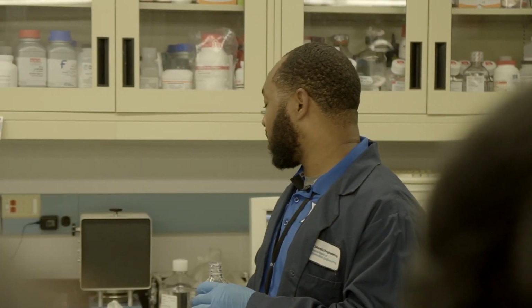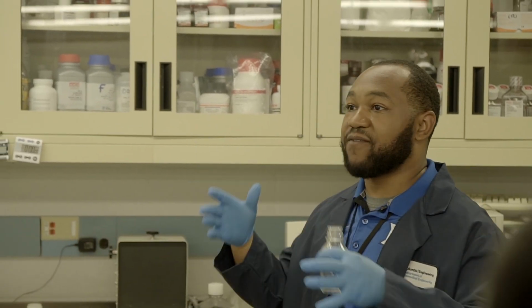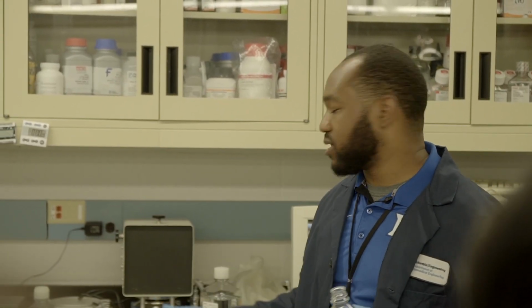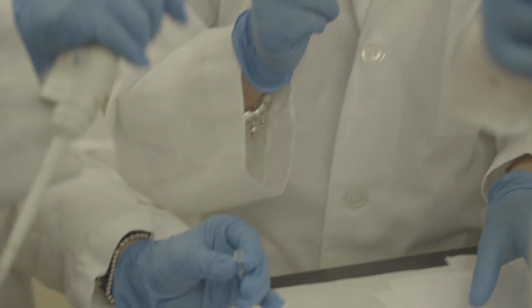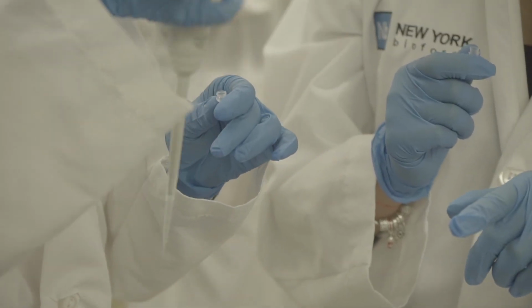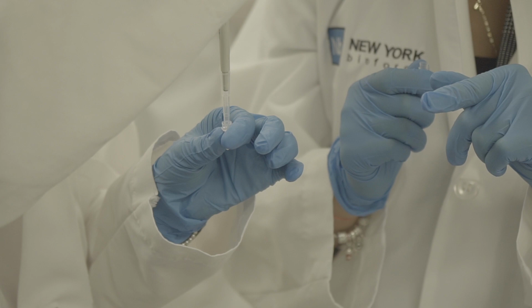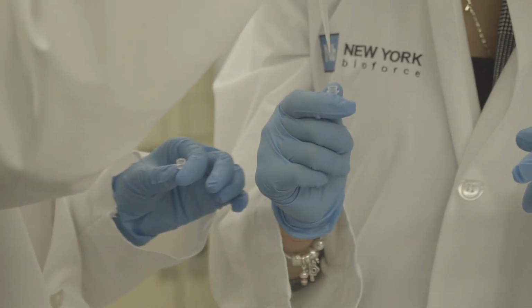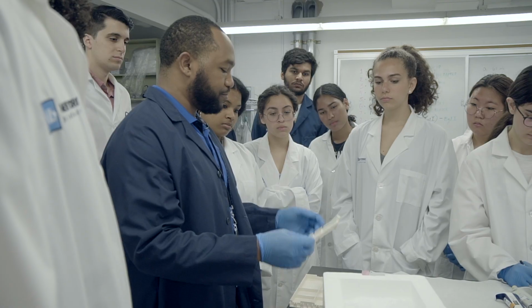I am going to take this cast to that end of the room. Christy's going to stay here, so maybe half and half, you all can watch what both of them look like, and we'll go over why each component of this matters. Cool? Hang out right here. So this is the general casting. The large rectangle is for a larger gel, and that corresponds to the teeth, right? So large gel, you can fit more bands of plasmid, basically.